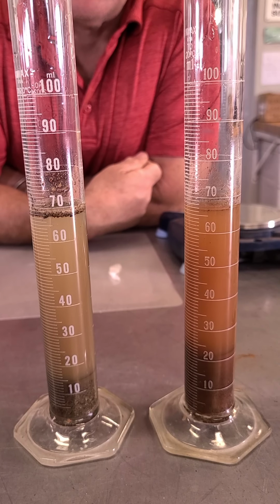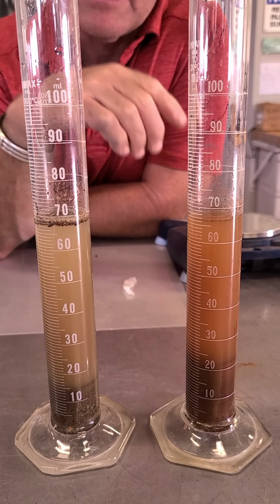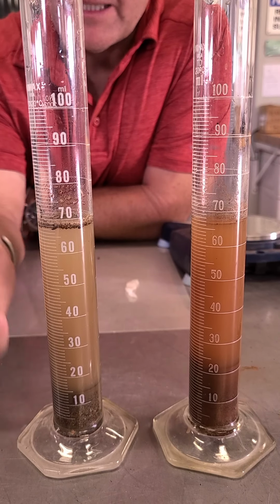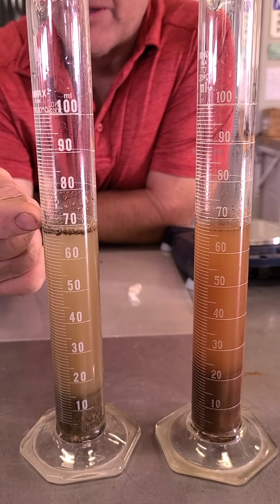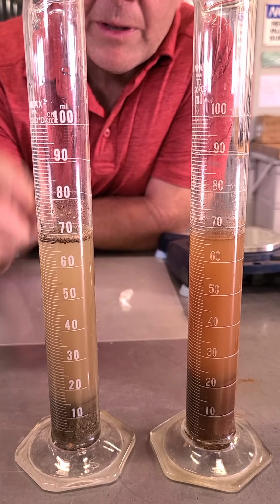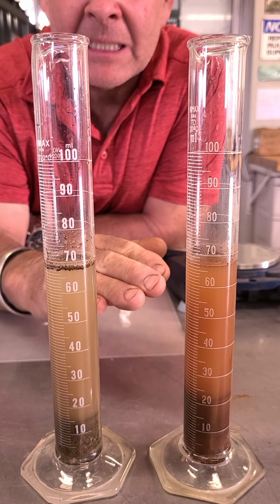Okay, so after I tapped it and shook it, of course all the soil particles went up on the side, so I added another 20 mils of water to each one to bring those particles back down. You can still see there's a little bit of debris sitting here on top, some particles that didn't want to sink, or perhaps some organic matter. But we now have 60 mils of water in each one of these samples and 20 grams of soil, so everything has been done exactly the same.